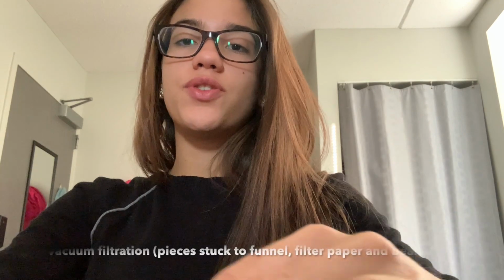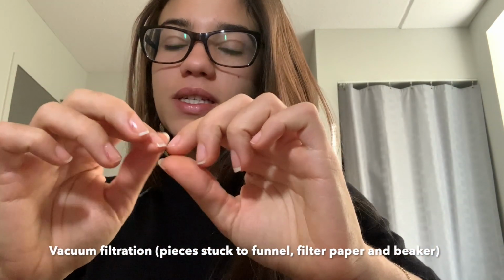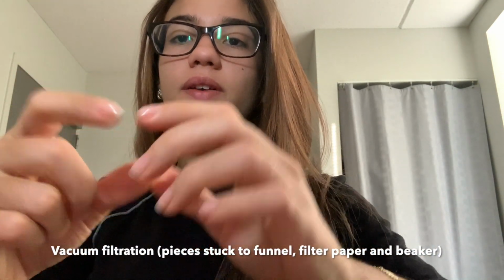So as calculated, the percent yield was about 54%, and this was not exactly 100%, and this may be due to some random errors. Firstly, the vacuum filtration had some little pieces of alum caught in both the Buchner funnel and in the beaker and in the filter paper. And even though we rinsed it out with ethyl alcohol, we rinsed the beaker, the funnel, and the paper as much as we could, there could have been some little pieces of alum left behind.